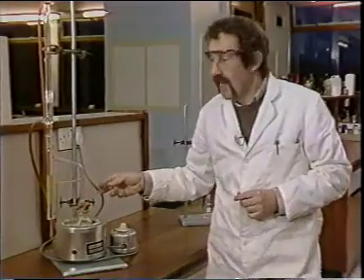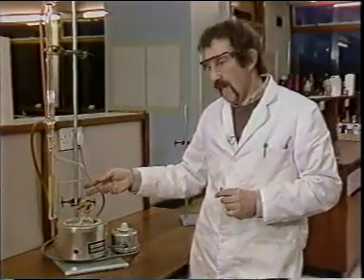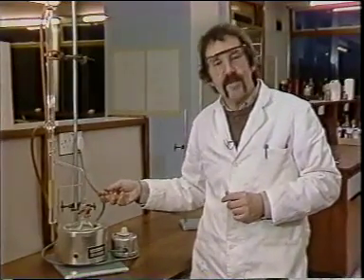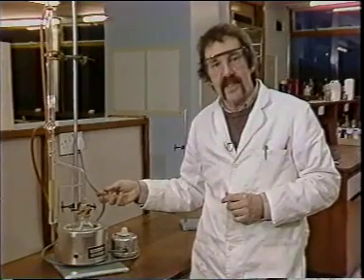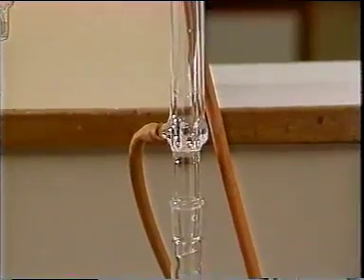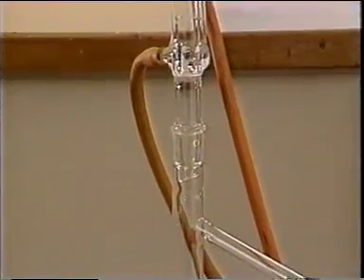And more extracting vapour and solvent is continuously regenerated. Now it might seem a bit of a bother to have to set up an apparatus like this, but in fact it only takes about as long as doing two conventional funnel separations, and it does give you the added advantage that you have only a small amount of liquid when you reach the end.